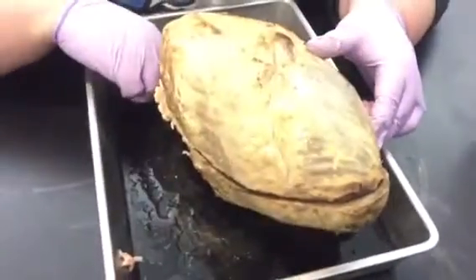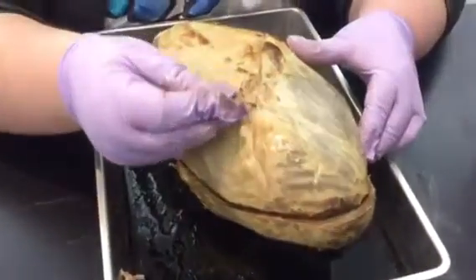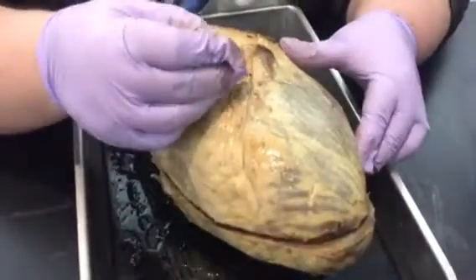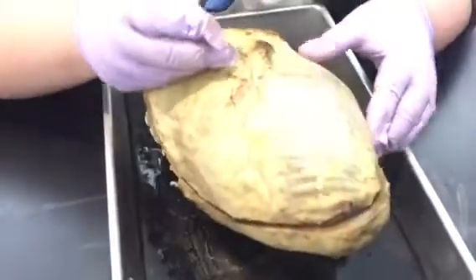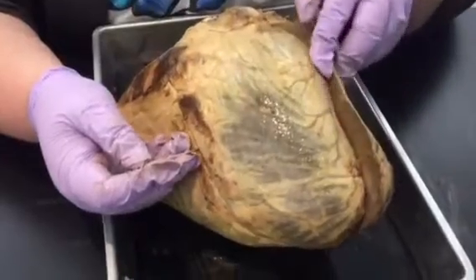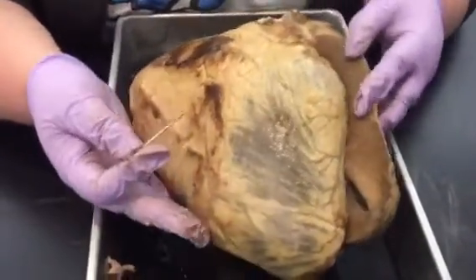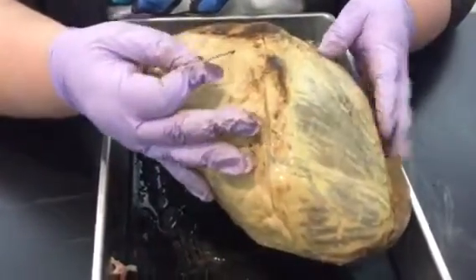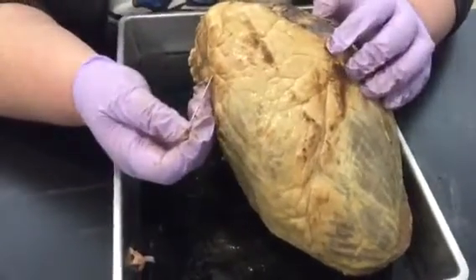The arteries you see running along the front of the heart — and you can see this in the cat too — all these little arteries are the coronary arteries and coronary veins. There's a really big coronary artery right there. They could also ask about the adipose — that's just all this fat.